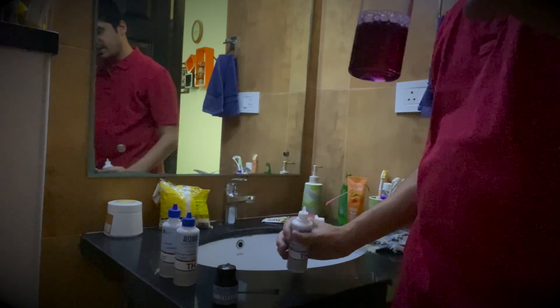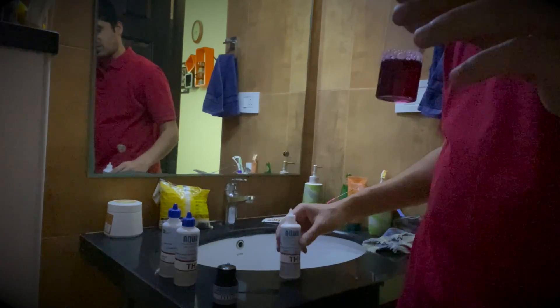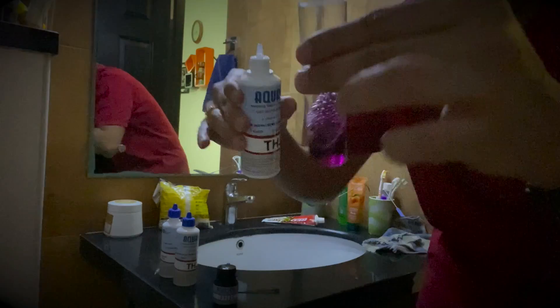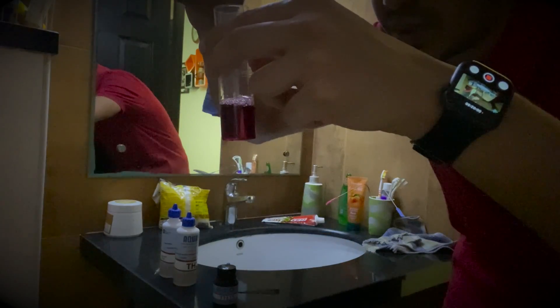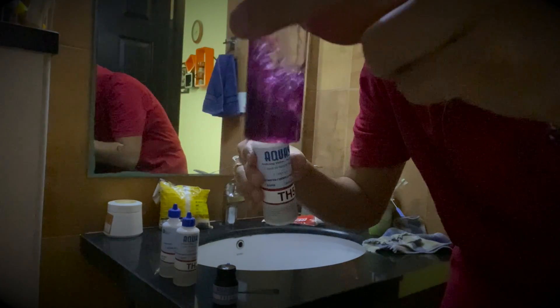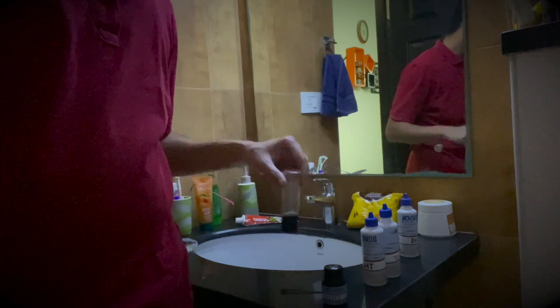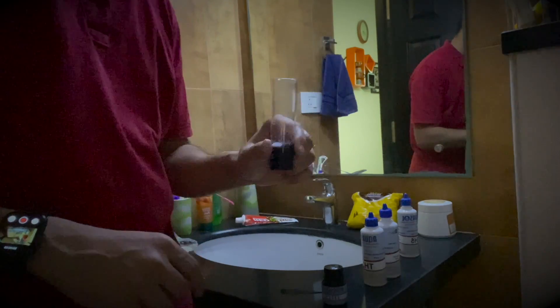If after entering TH2 the water turned blue, it means there's no hardness present in your water at all. But since it's turned a shade of red, we have to check the hardness level by entering these TH5 drops. So let's start — 1, 2, 3, 4, 5, 6, 7, 8 — and you can see the water is now turning blue. So 28 multiplied by 25 equals 700 ppm of total hardness in the water currently before regeneration.